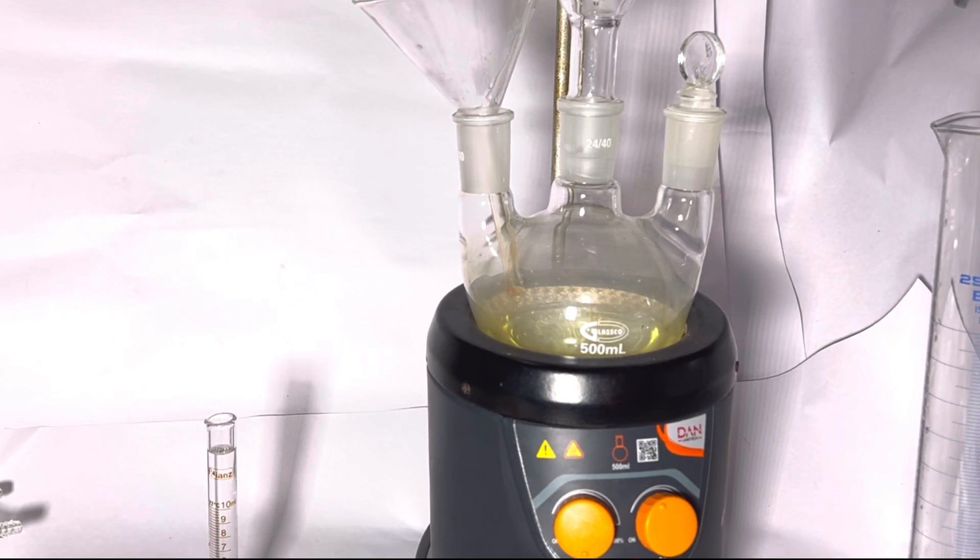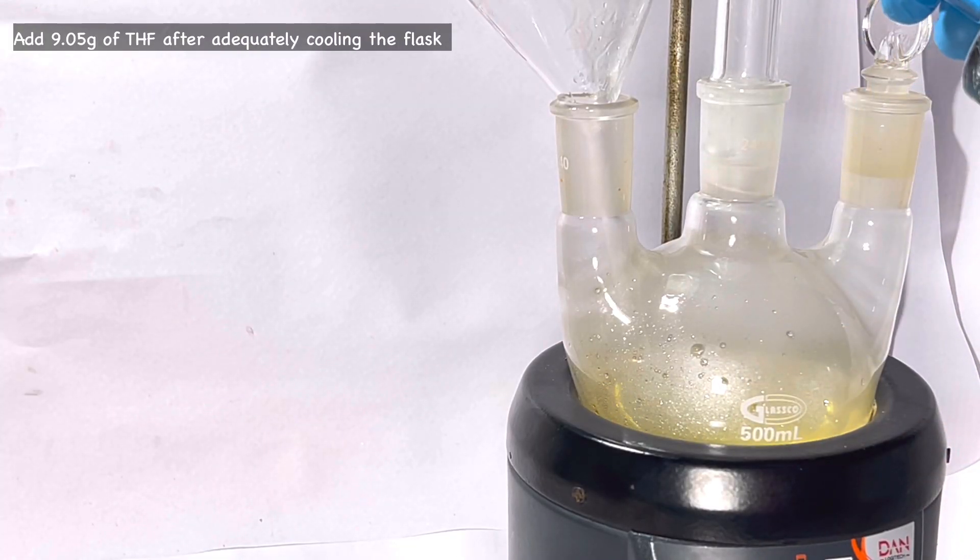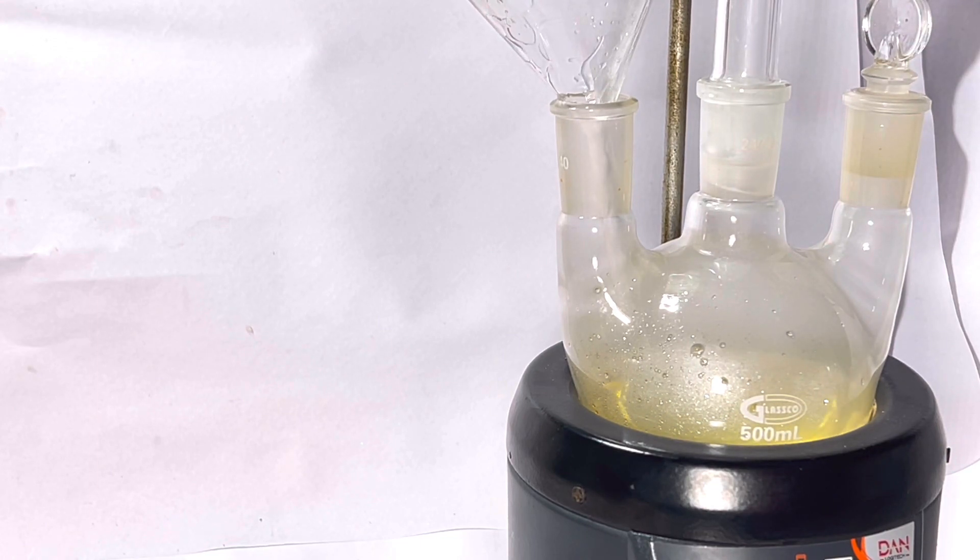Once the sulfuric acid is added, allow the flask to sit for some time so that the contents of the flask get cooled down to room temperature. We need the flask to cool down before the next step of addition of the tetrahydrofuran as the tetrahydrofuran has very low boiling point.